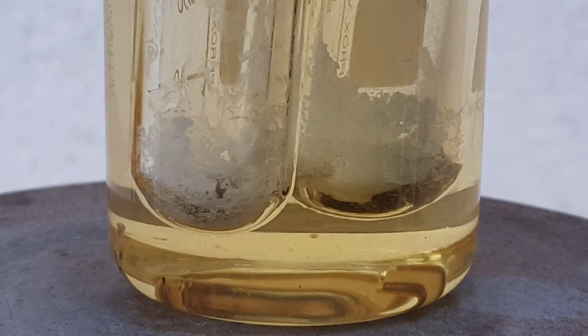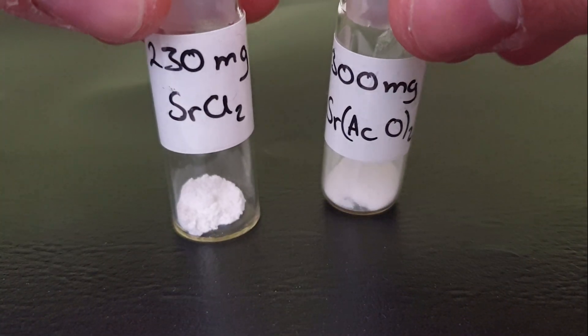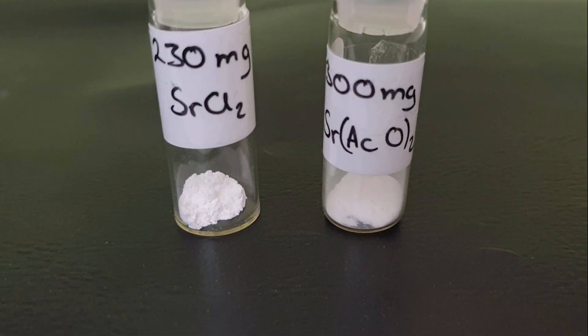After only two hours, all the water had evaporated, and I transferred the product to some vials. The yield for both is of course quantitative.